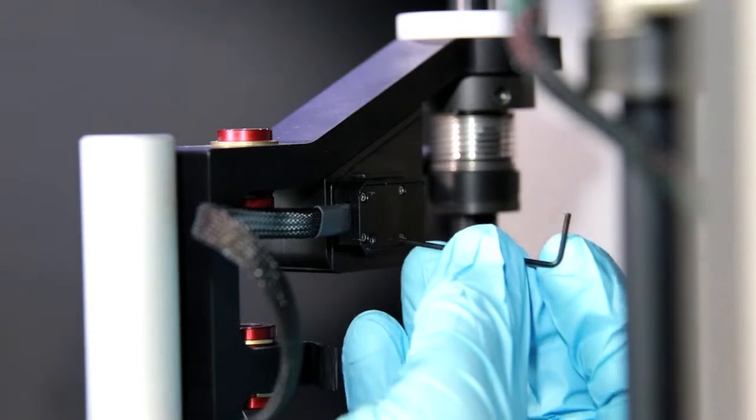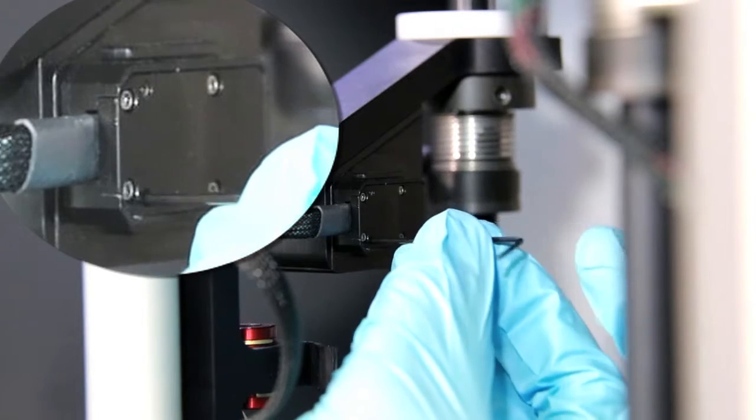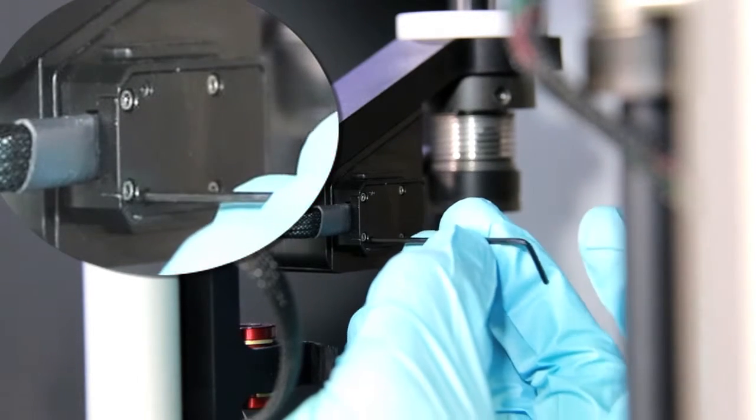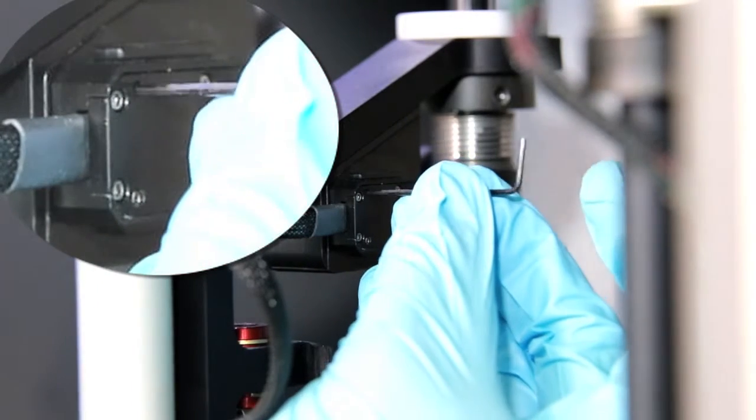Once the syringe glass is removed, simply loosen these two Allen screws and only these two Allen screws.